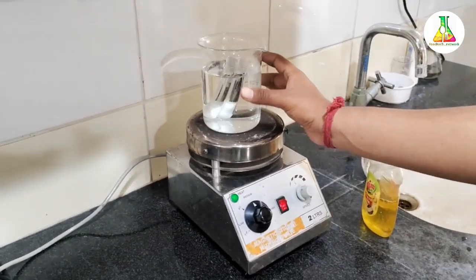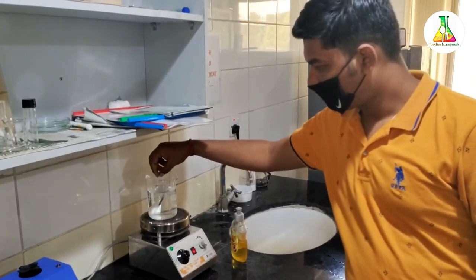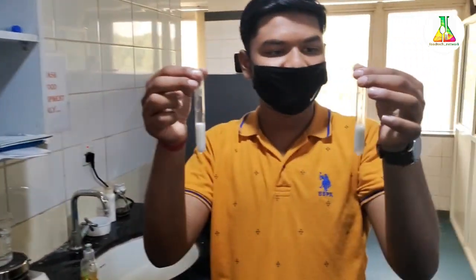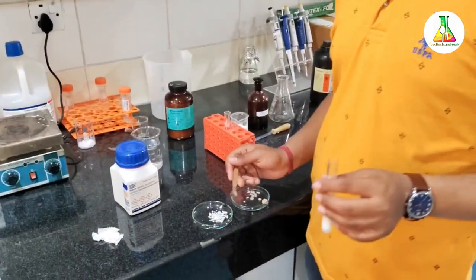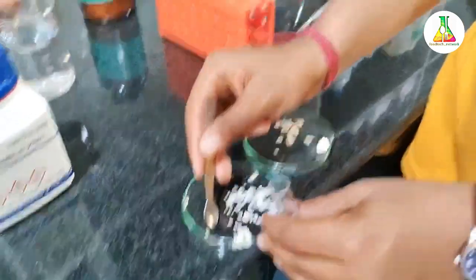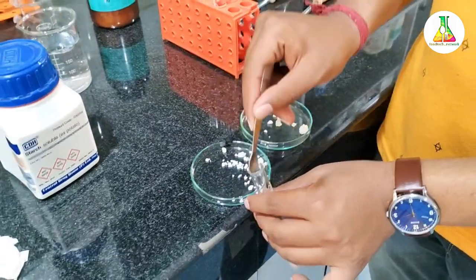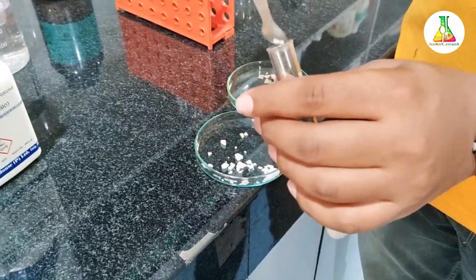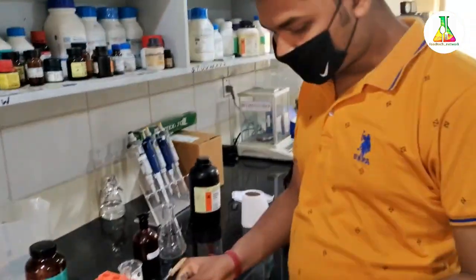First, we need to make our milk samples ready for the reaction. We will incubate them in warm water using a water bath. If you don't have a water bath, simply use a beaker filled with warm water and place your test tubes in it for a few minutes. This sets the right conditions for the reaction to proceed — this step is known as conditioning the milk sample. The water bath is at around 100 degrees Celsius; we will keep the samples in it for only one to two minutes, then take them out.